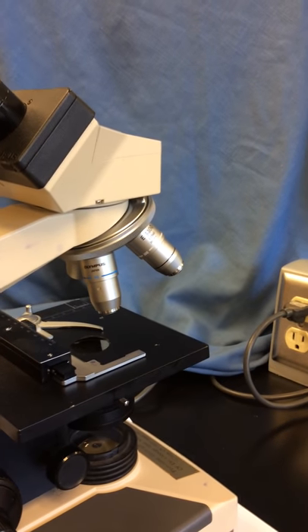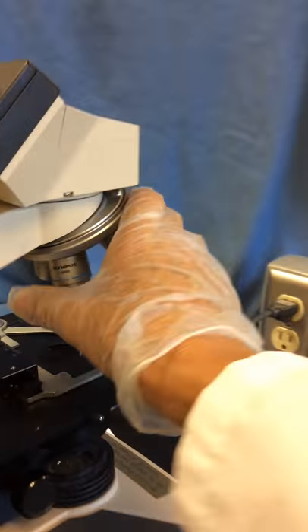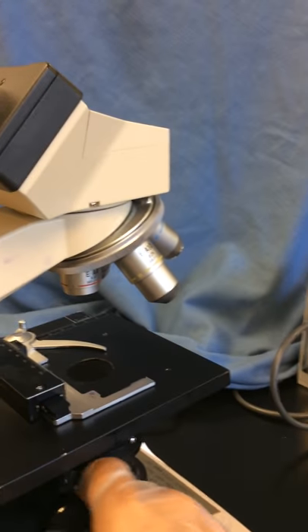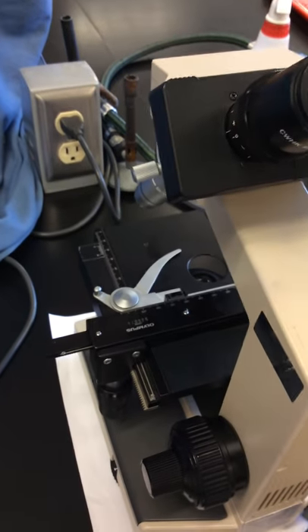In addition, when we're replacing our microscopes, we can lower the sub-stage condenser. Very importantly, we want to make sure the mechanical stage has been centered. You can see right here, the arm of the mechanical stage is sticking out quite a bit beyond the stage.